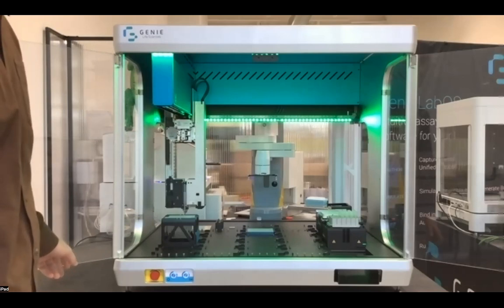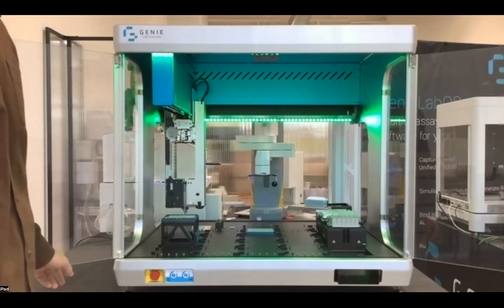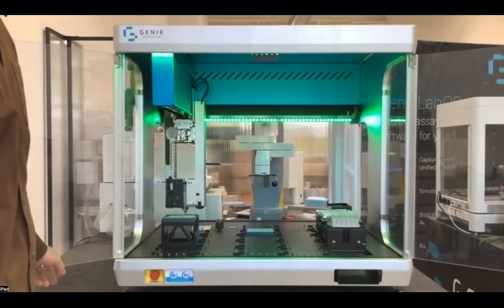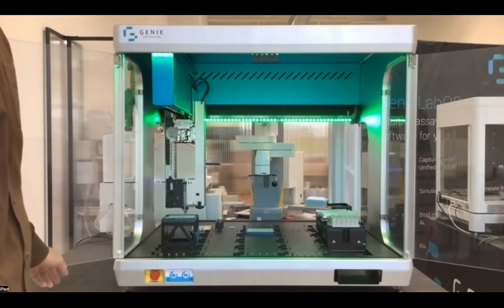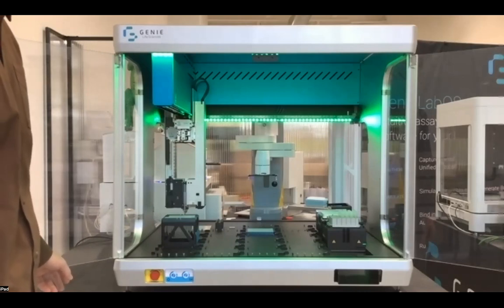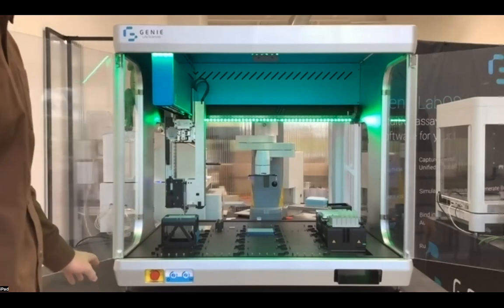With the modularity of this system, you will remove current bottlenecks in the lab ecosystem, as the need for an engineer to come on site and troubleshoot and diagnose is going to be greatly alleviated by the ability to swap out your main pipetting component of the head.